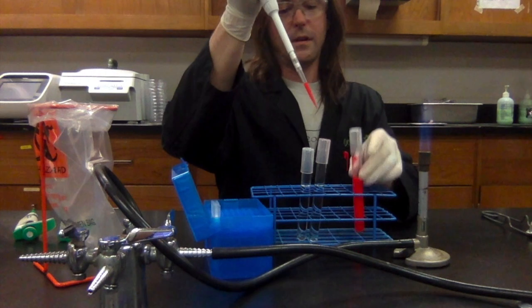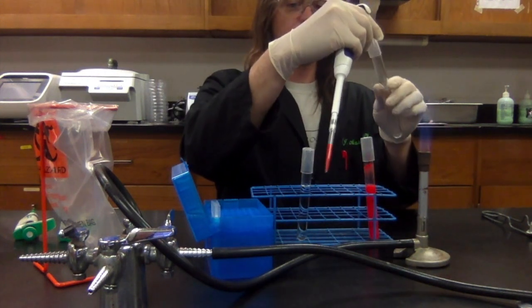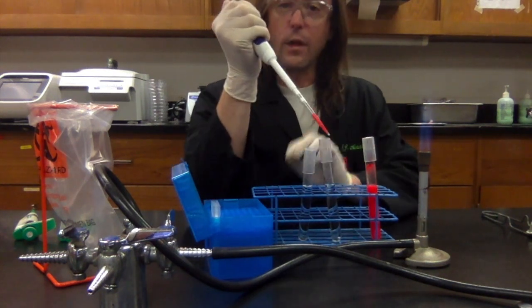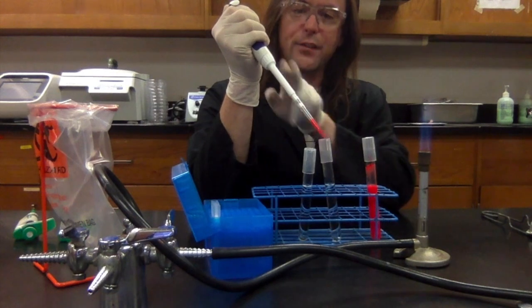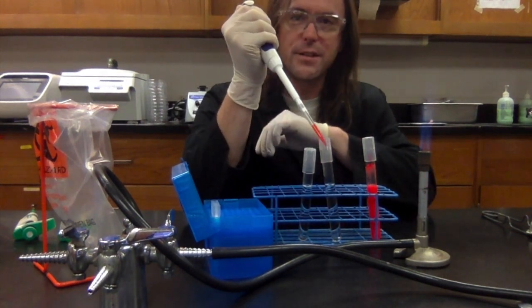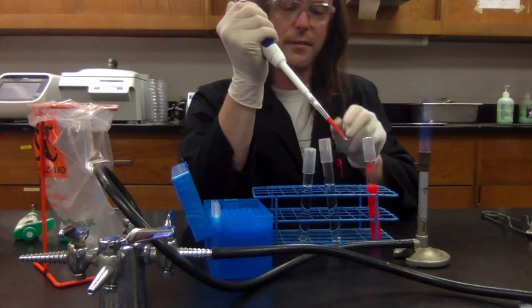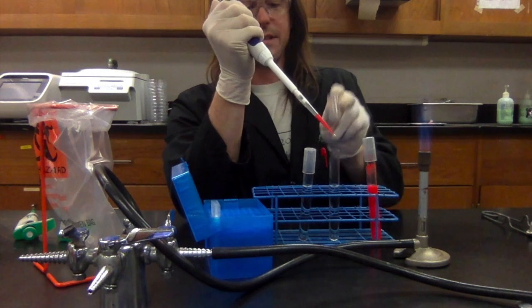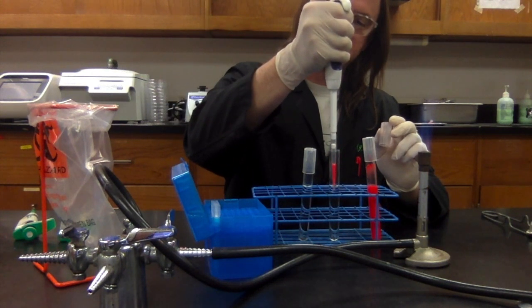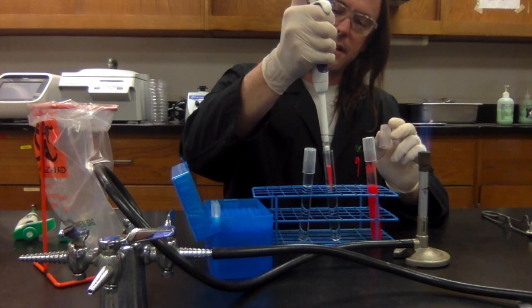Okay? All right. So the next thing I'm going to do is I'm going to pass this other tube briefly through the flame. While I'm doing that, I'm keeping in mind exactly where this tip is at all times. I don't want to start waving it around. I don't want to touch it to anything else, right? I want to kind of keep it within the force field of the flame. All right. So now I'm going to lower this down until the tip is just underneath the level of the liquid, and I'm going to slowly press down on the plunger.